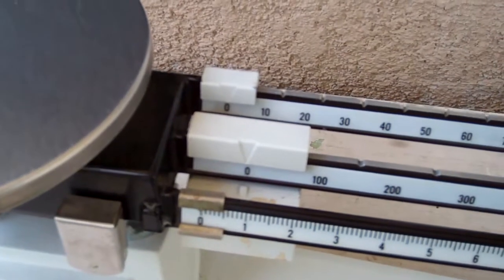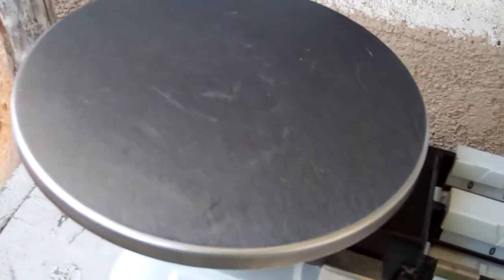Nothing on the pan. Riders are on zero. Nothing on the pan. And the zero line is okay. And if you notice, the zero line is not okay. This happens a lot. So that's easy to fix.